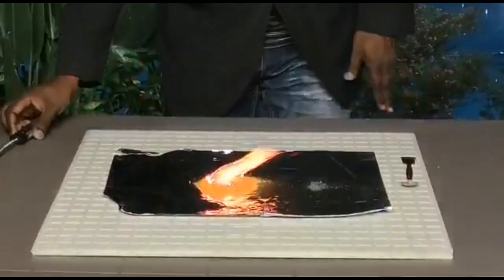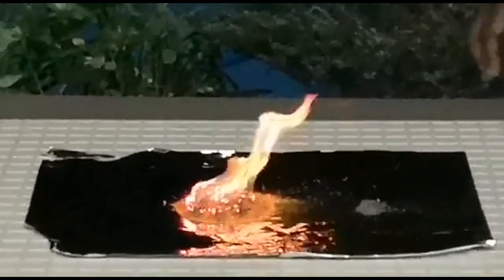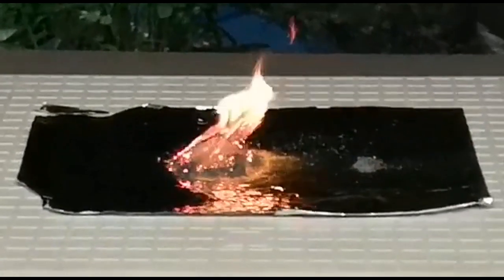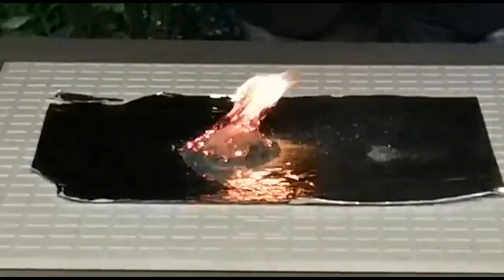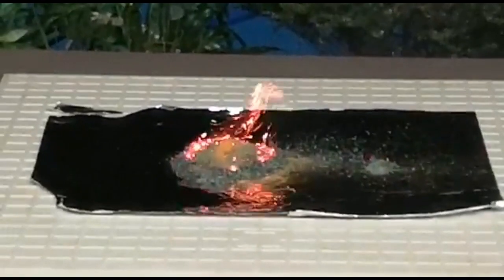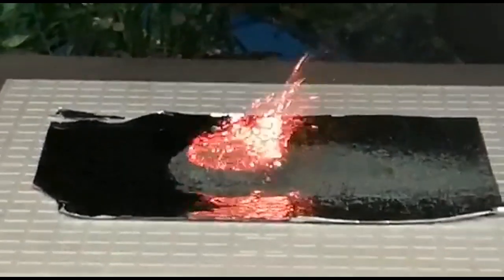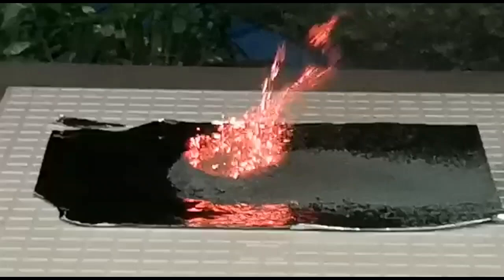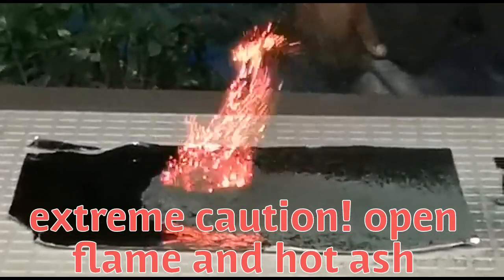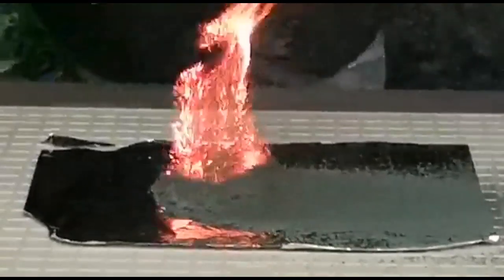So let us see why that is the case. If we zoom in, we could actually get a feel for this volcano effect. You'll see that the orange powder is now converting into a beautiful dark green, and as you zoom in, you can actually feel the heat being generated. It looks very much like a volcano that's erupting — it's a beautiful color. Look at the volume of that green ash coming out.